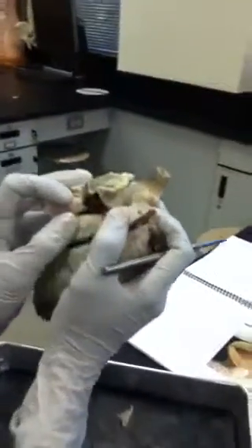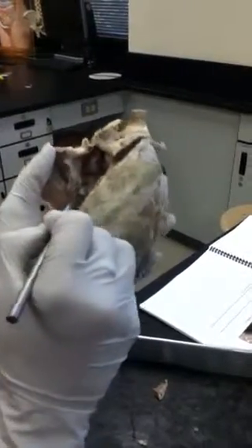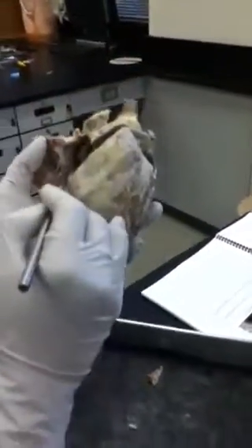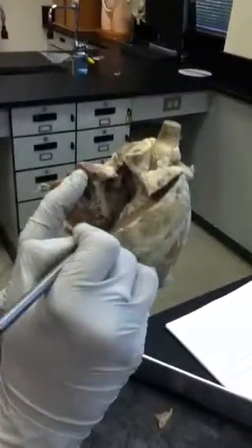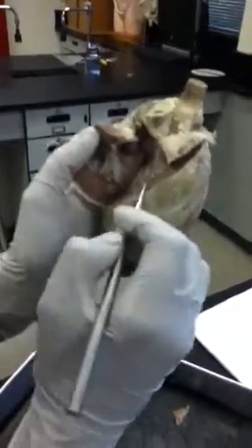Blood flows from the right atria down into the right ventricle through the tricuspid valve. Here you can actually see the tricuspid valves. There's three: 1, 2, 3. Each of these valves is connected to muscle of the right ventricle through these cords called chordae tendineae, the cords of the heart. The cords are attached to the muscle of the right ventricle through what we call the papillary muscles.